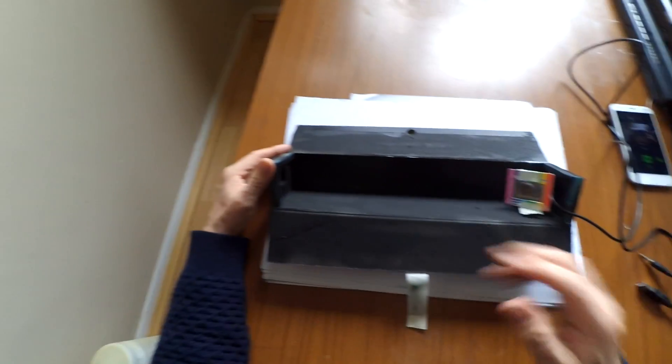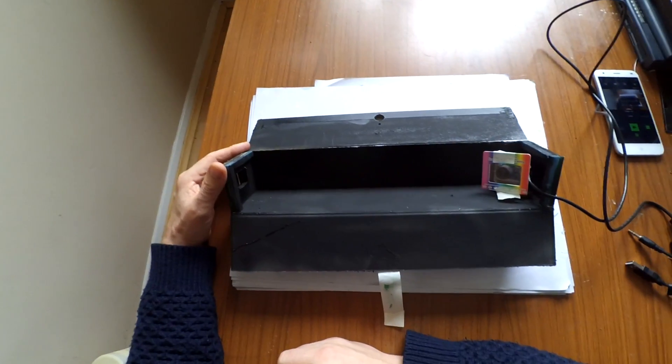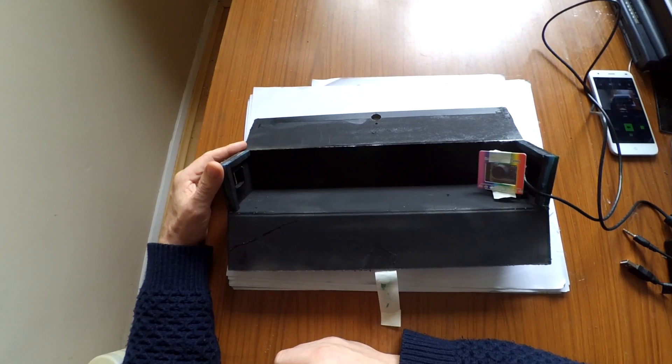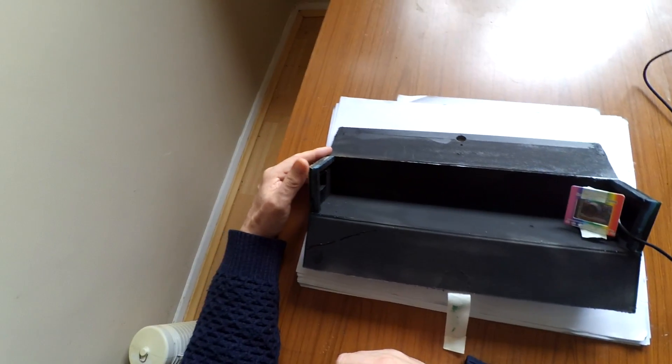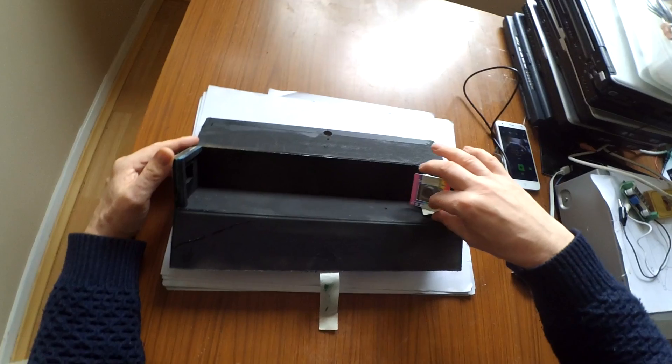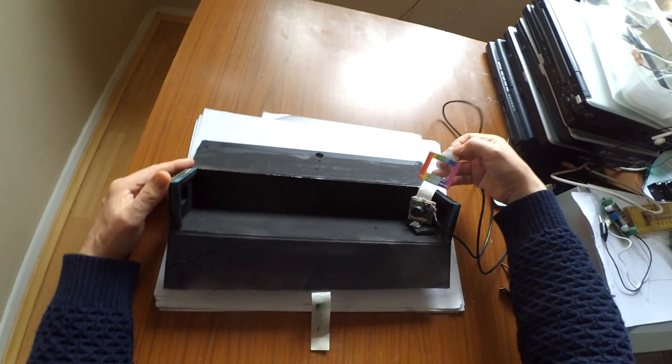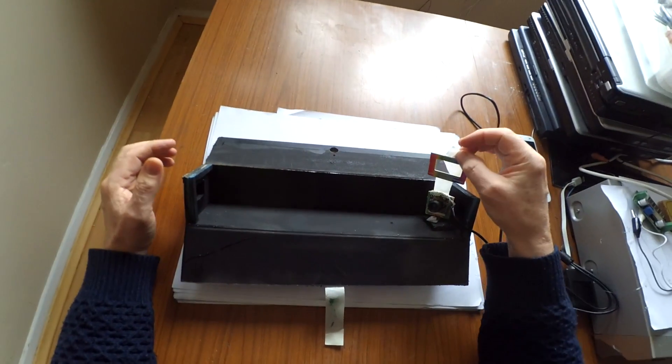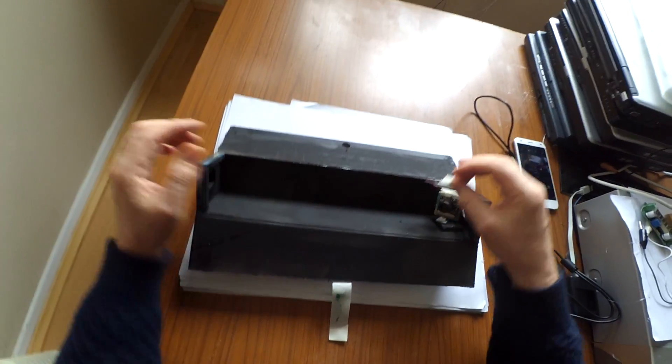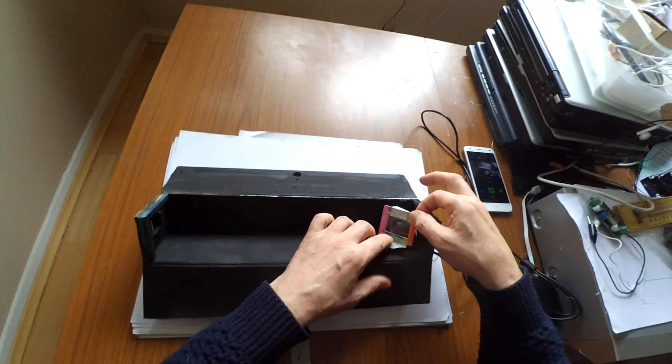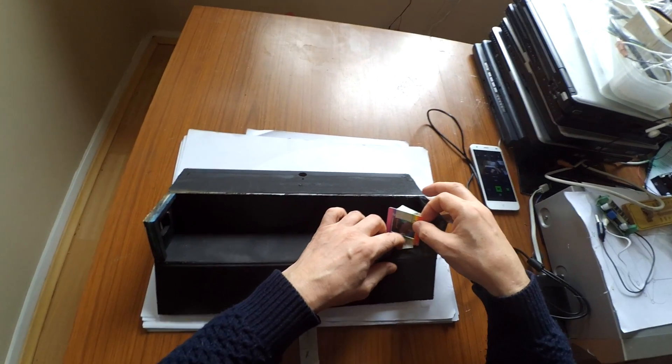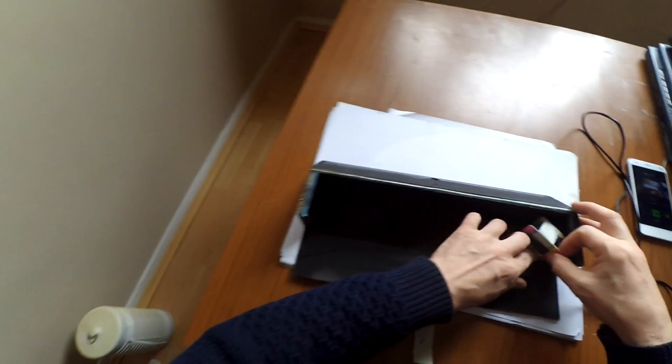I've left it quasi open like this to allow me to make modifications inside. Slit one end, webcam at the other. Across the lens of which is a diffraction grating which is a thousand lines per millimeter, just held in place at the moment with some masking tape.